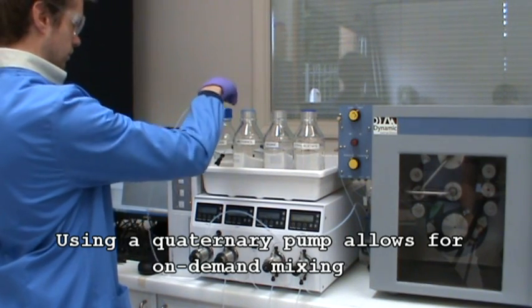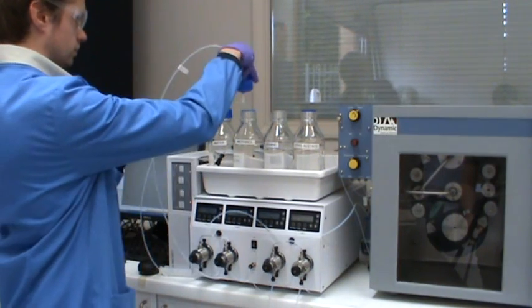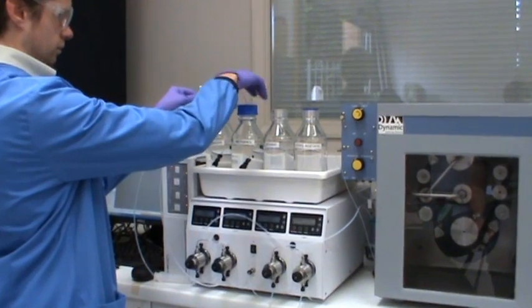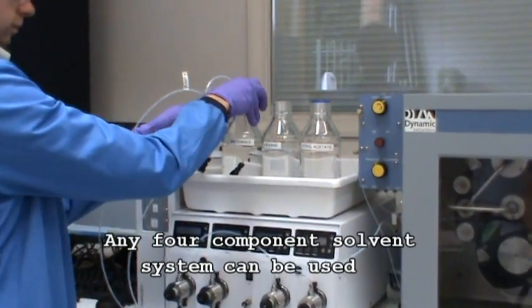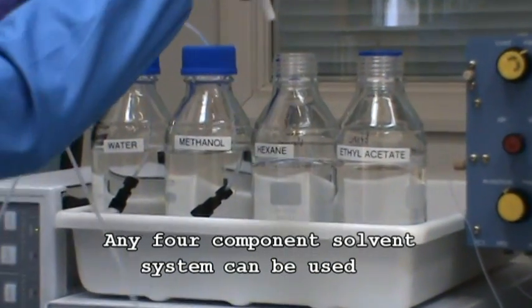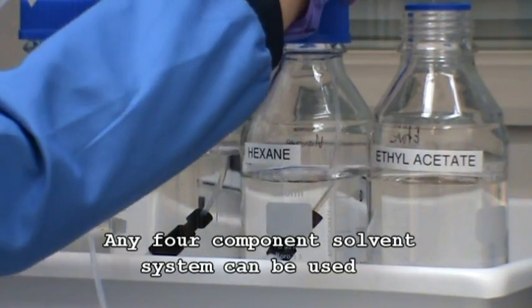During this video we did use a quaternary pump, however we used it with manually mixed solvent systems. When using a quaternary pump like this, you can control the pump with the chromatography software to mix your four component solvent system on demand. This makes mixing solvent systems a lot quicker and more straightforward.